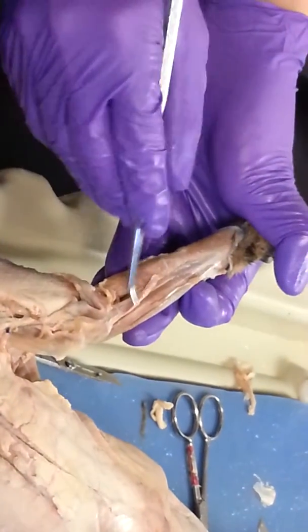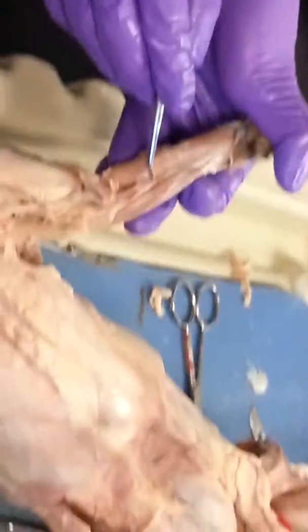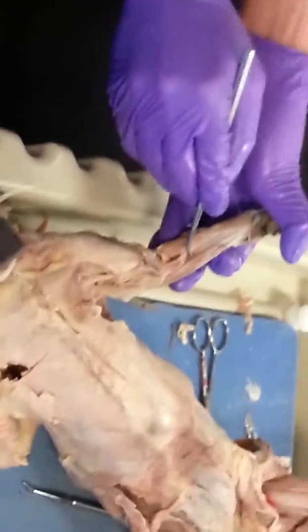And then this one, it got a little bit ripped off by me, but this tiny one that starts at the elbow and kind of dies. Pronator teres. See the little tiny elbow one right there.